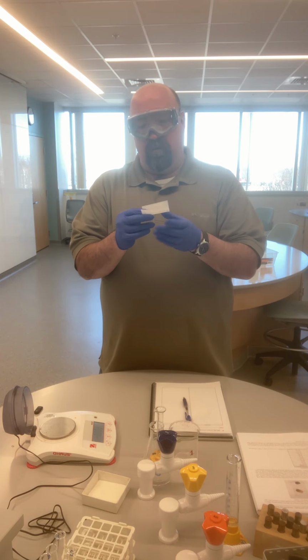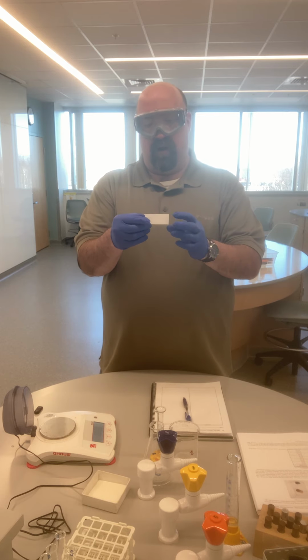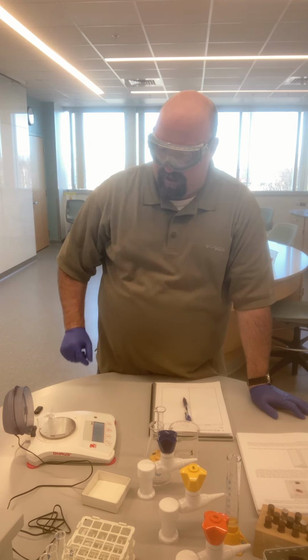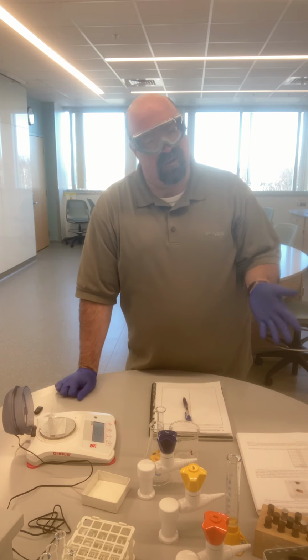The way that you would go about using weigh paper on a balance, one of the easiest ways I've found anyway, is fold it first. Put a crease in there. You'll see why in just a moment. But we put a crease on it and then open it back up a little bit. And then we would place that weigh paper onto the balance, and you'll see that the mass changes. I get 0.225 grams.